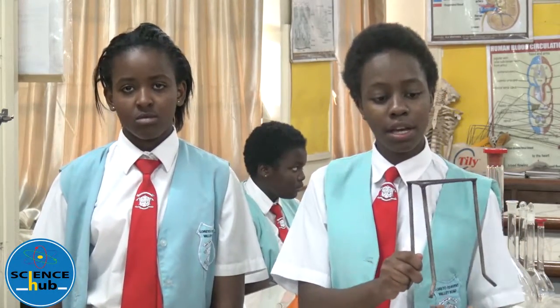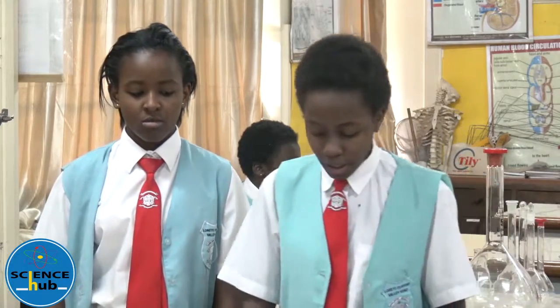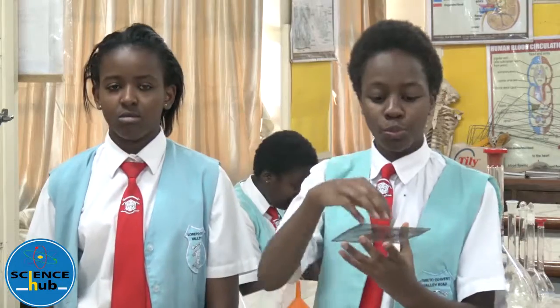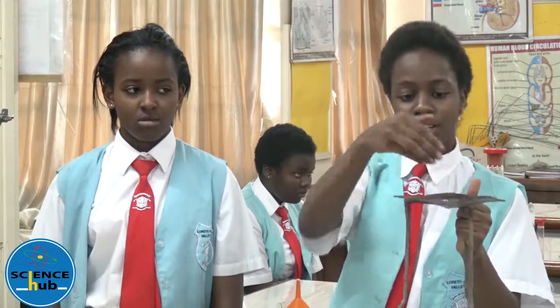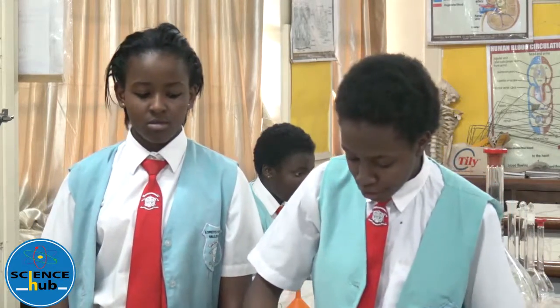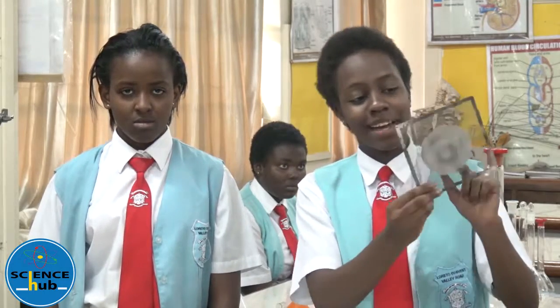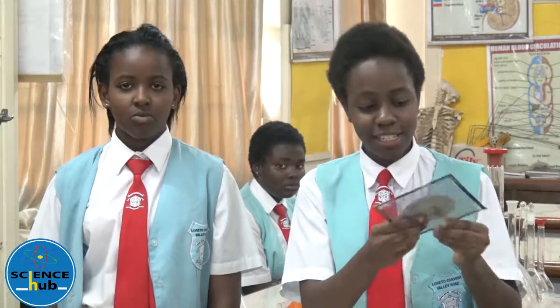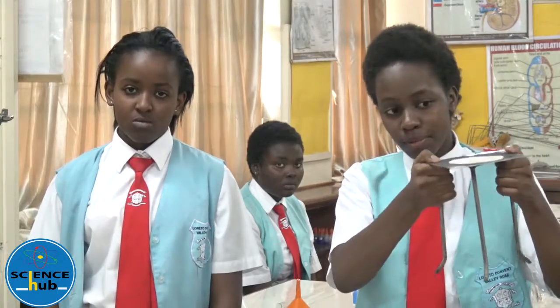This is a tripod stand which is used for heating — for supporting substances when you are heating them. The heat comes from underneath and you place whatever you are heating on top, so it acts as a stand. Here is a wire gauze which is placed on top of the tripod stand so that whatever you are heating does not fall through. The tripod stand also requires an asbestos sheet — this white thing — so that heat is evenly spread through the wire gauze.